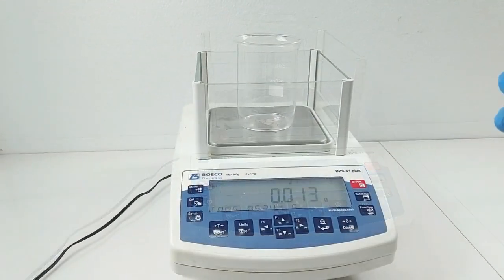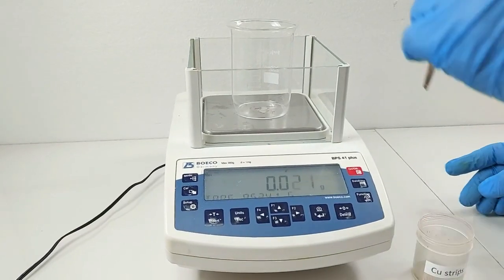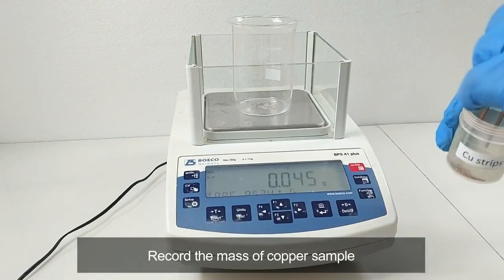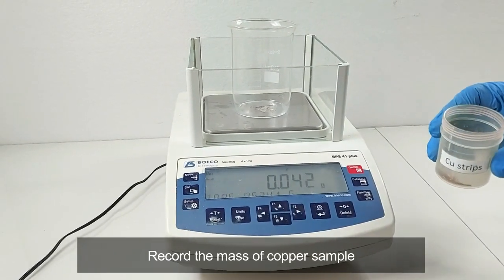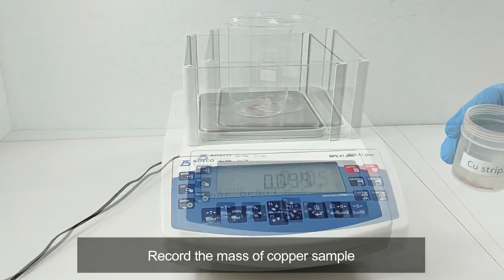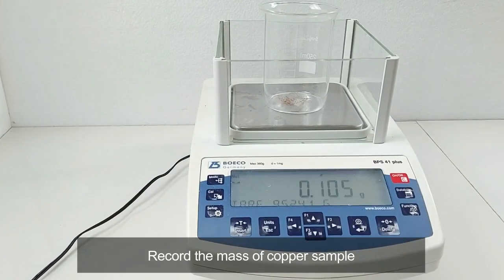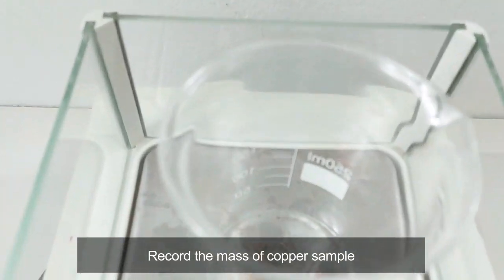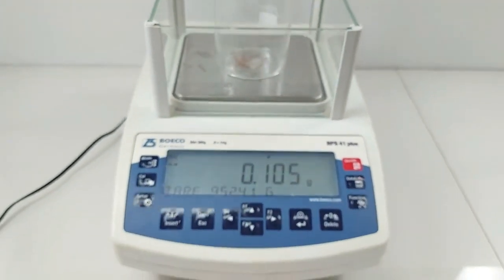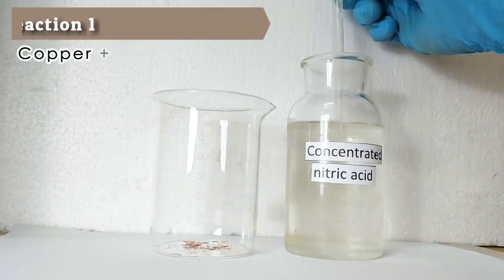Weigh approximately 0.1 gram of copper shavings. Find the mass to the nearest 0.001 gram and record the mass as mass of original copper sample. Place it in the bottom of a 250 ml beaker.